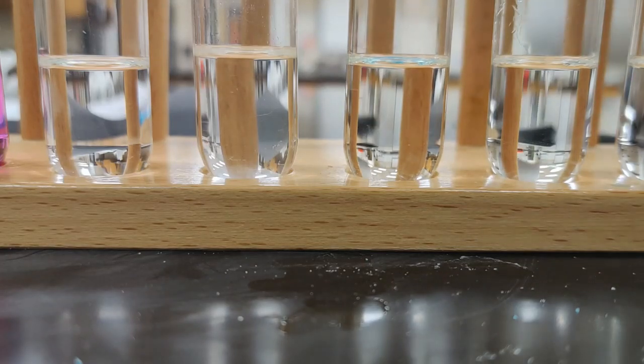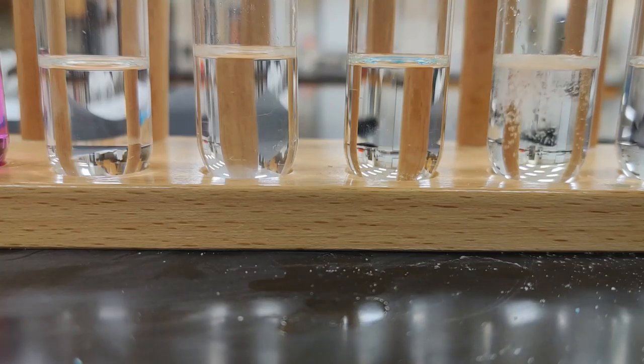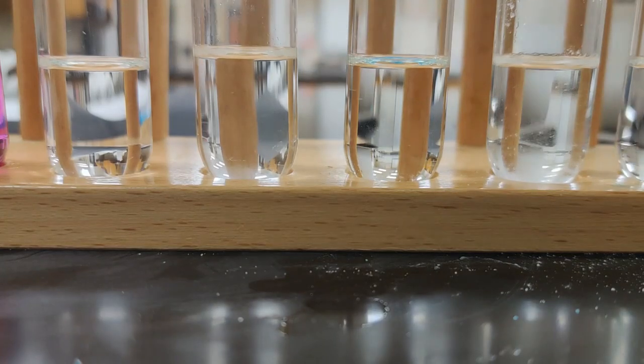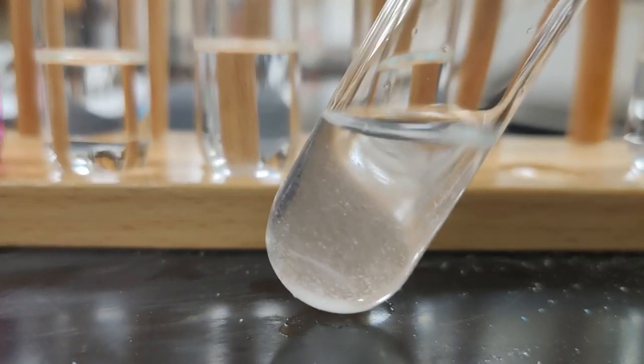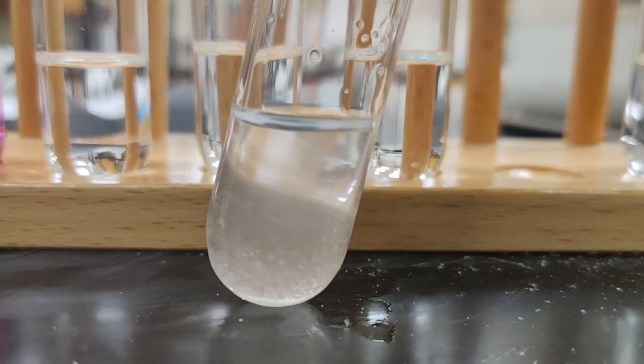All right, so we have glucose and sodium chloride, 2 more to go. See that glucose just kind of sinking down through. It's a very, very fine powder. Much finer than table sugar, which is sucrose. So I can see that it almost looks like a snow globe where it's just swirling around.